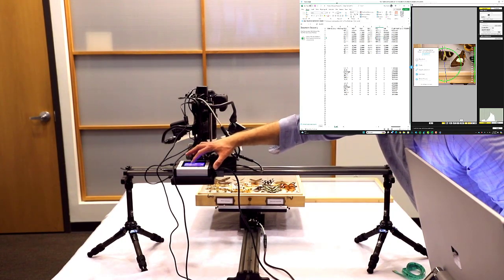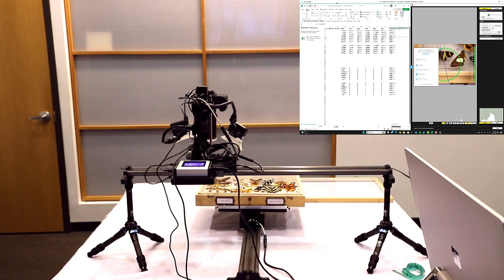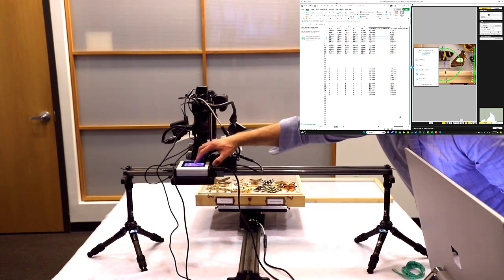Now we're going to go back home. Now we need to set up our Y-axis. These are not tied to aperture, these are tied to field of view. So this is that distance away from the sample that we're referring to. So here's our Y value. We set this to 5.07 millimeters.